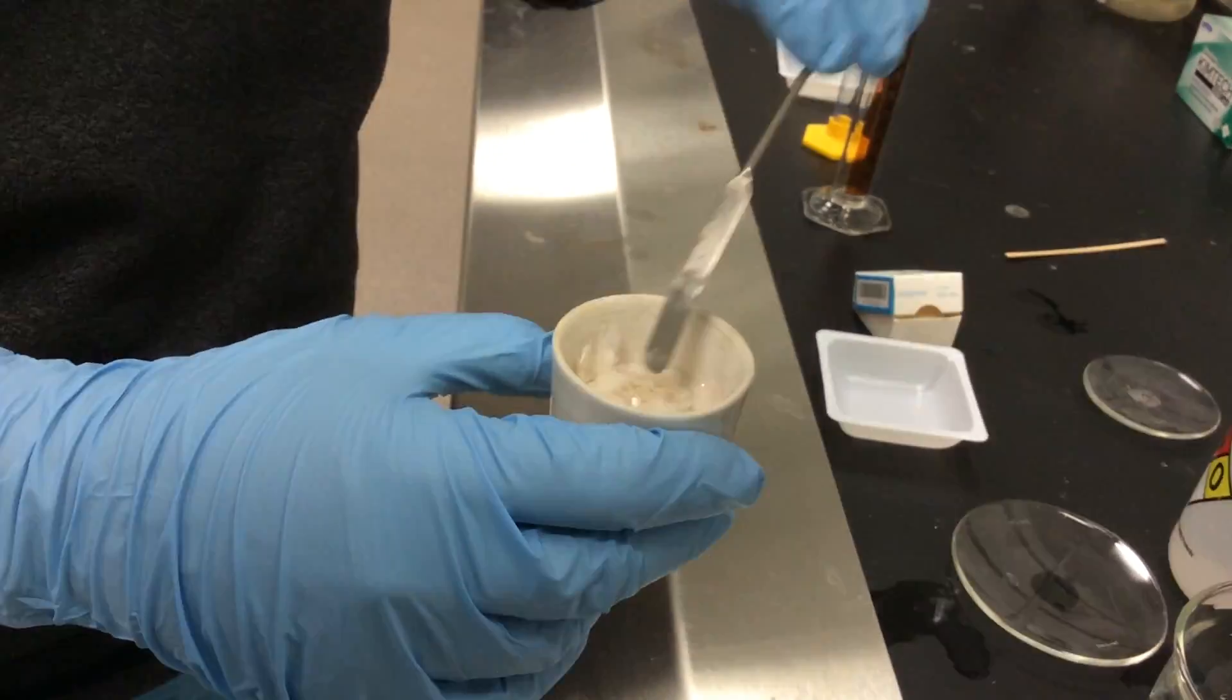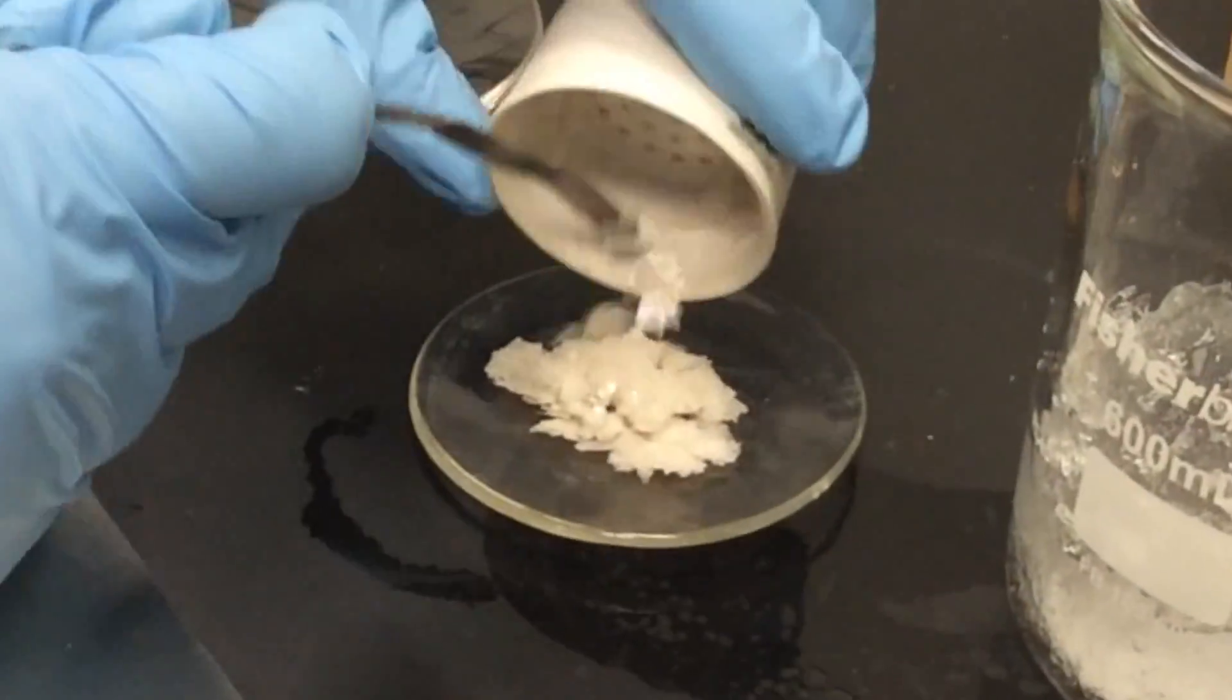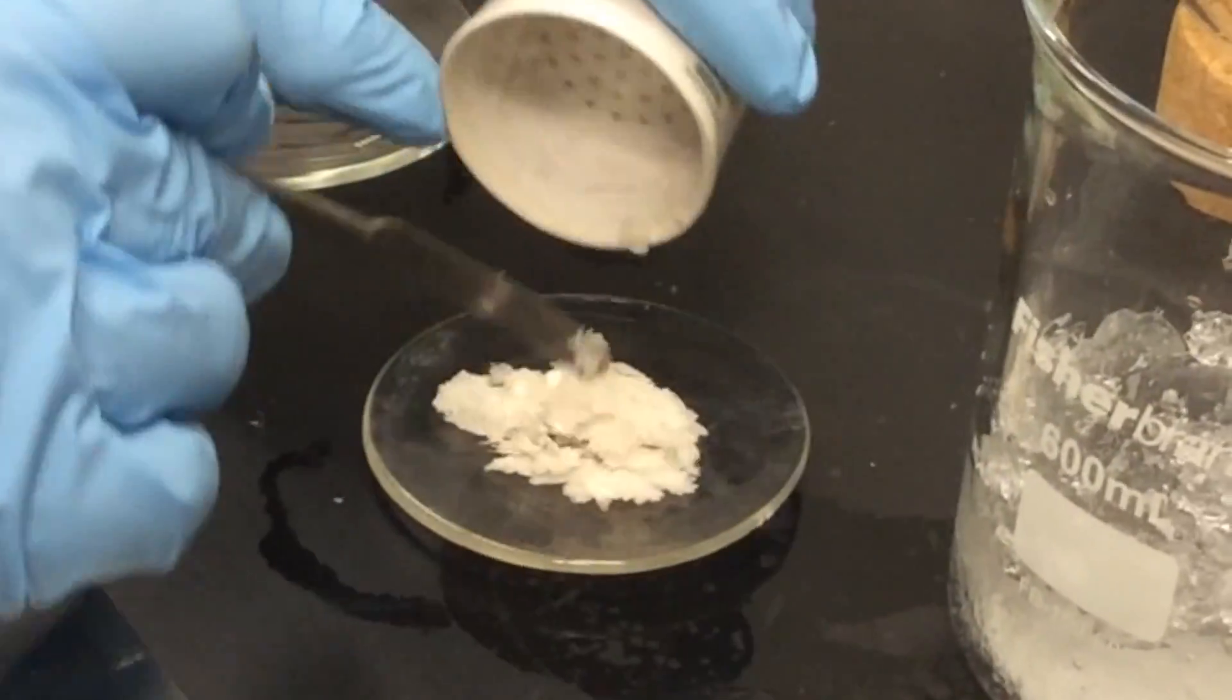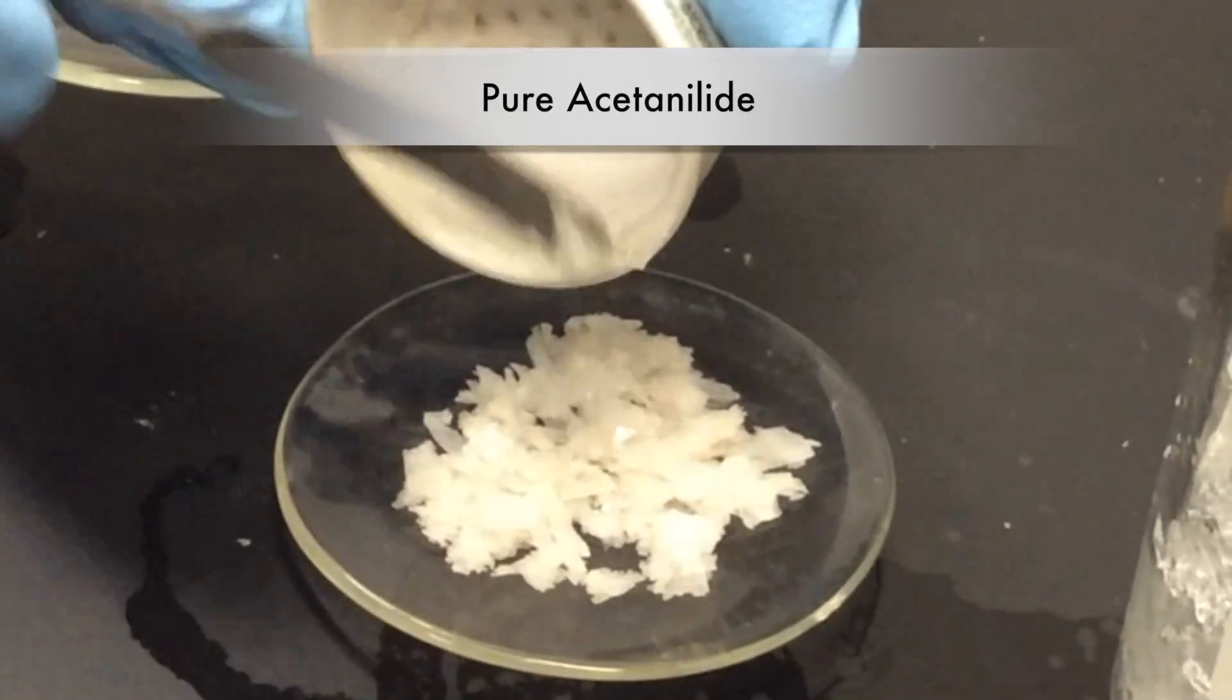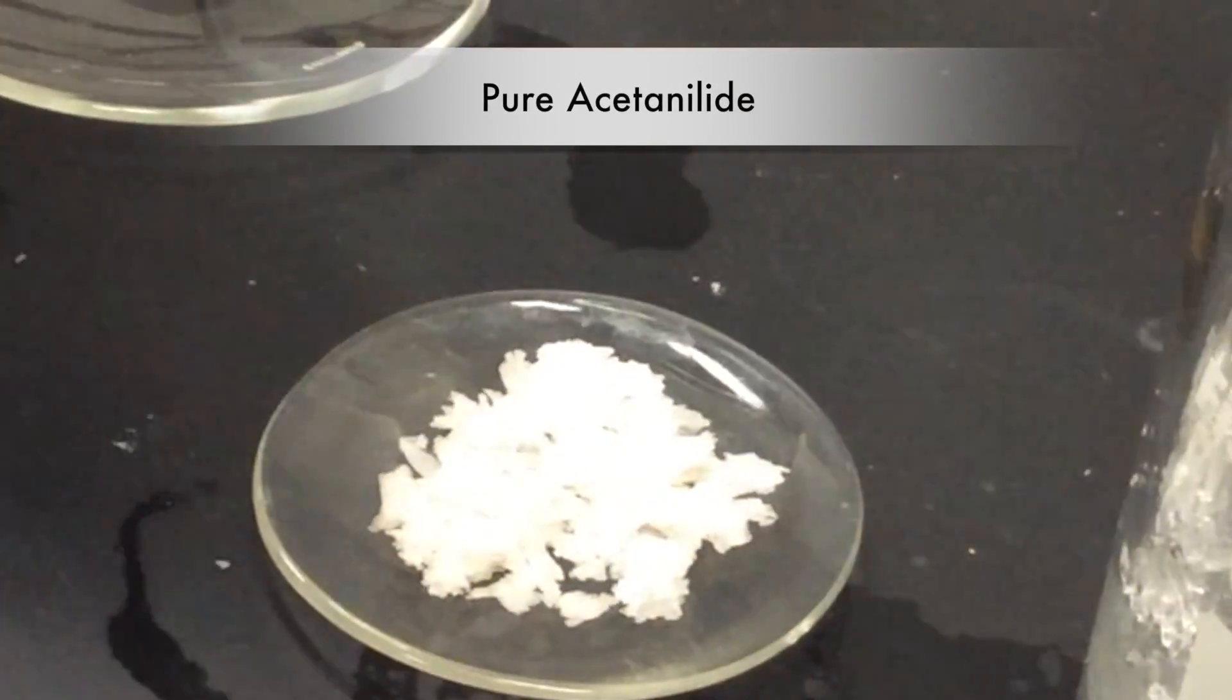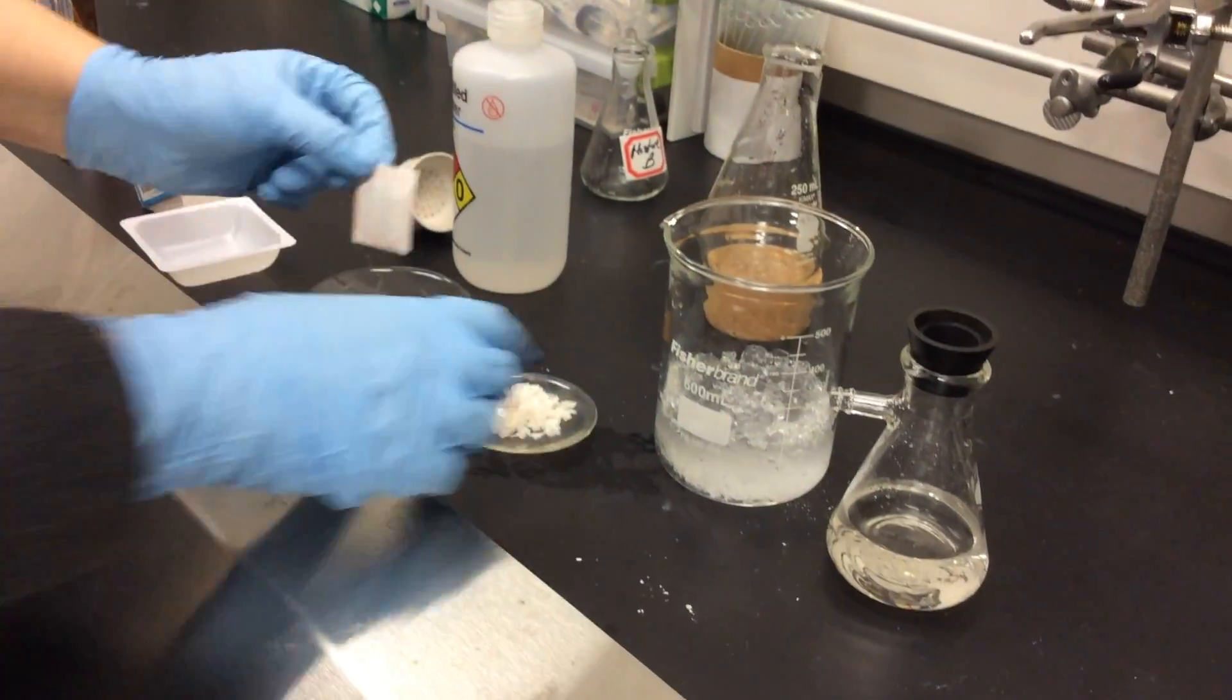We now take these crystals and we will put them on our watch glass. Again, just the crystals, not the filter paper. And you break up the crystals to make sure the maximum surface area is exposed to the air to ensure drying.